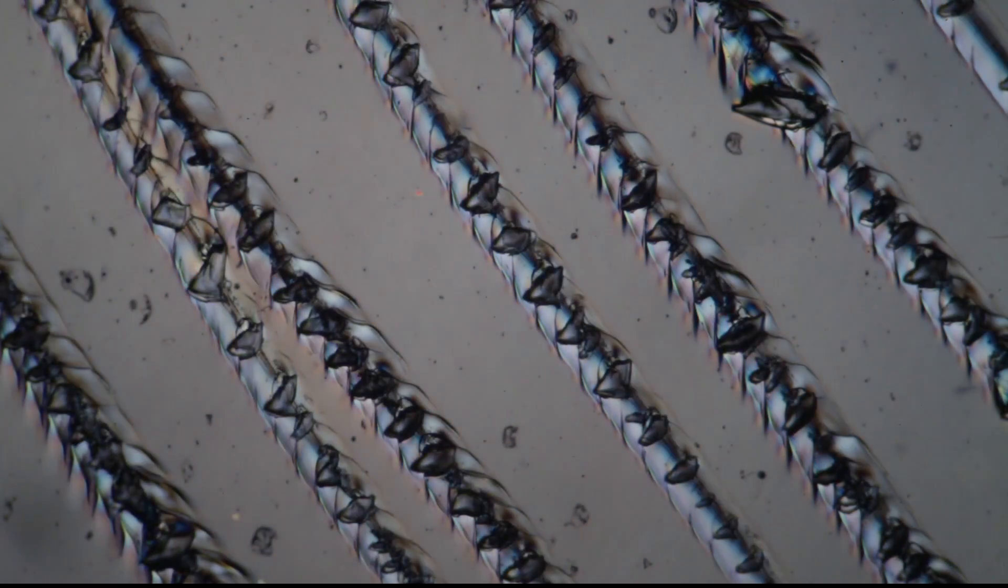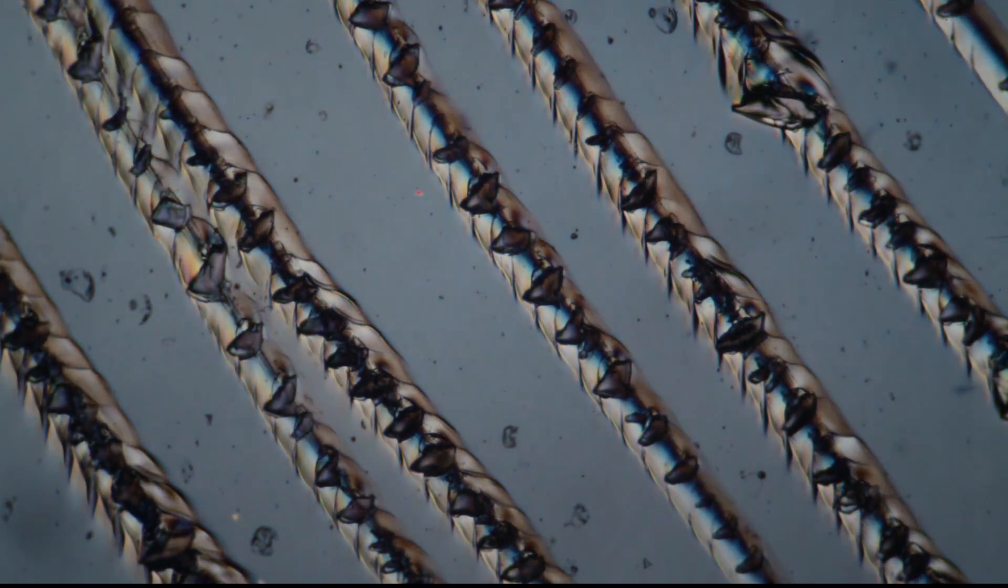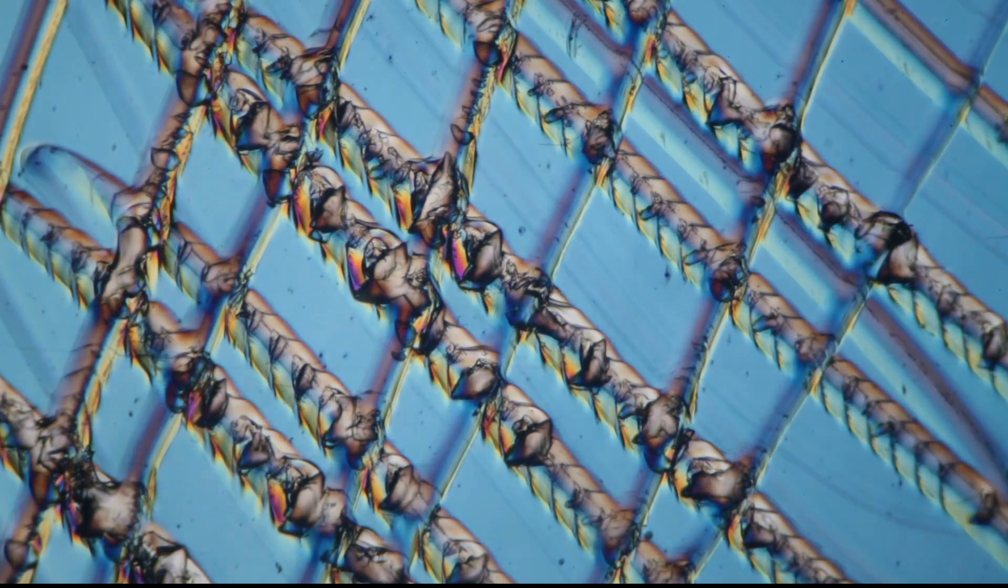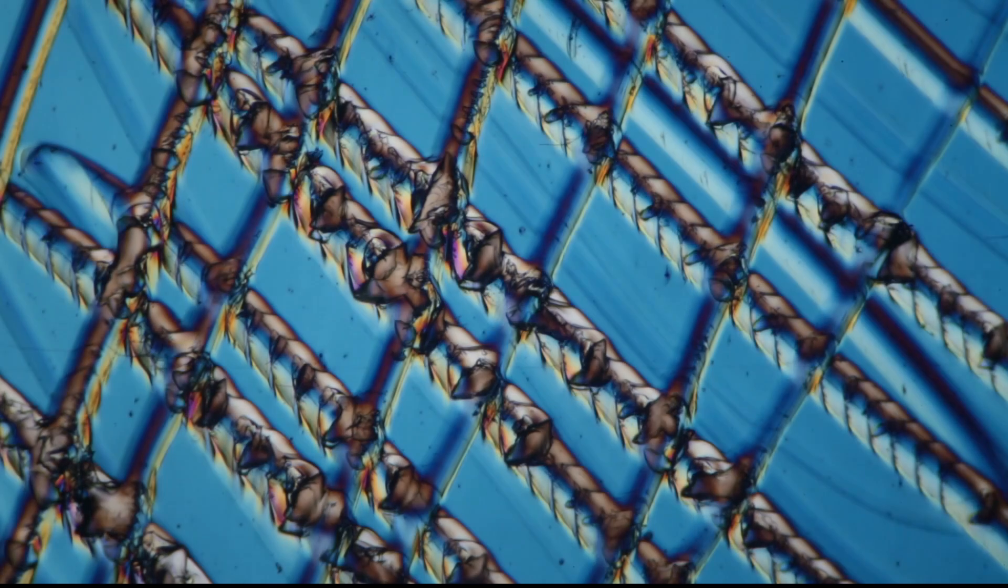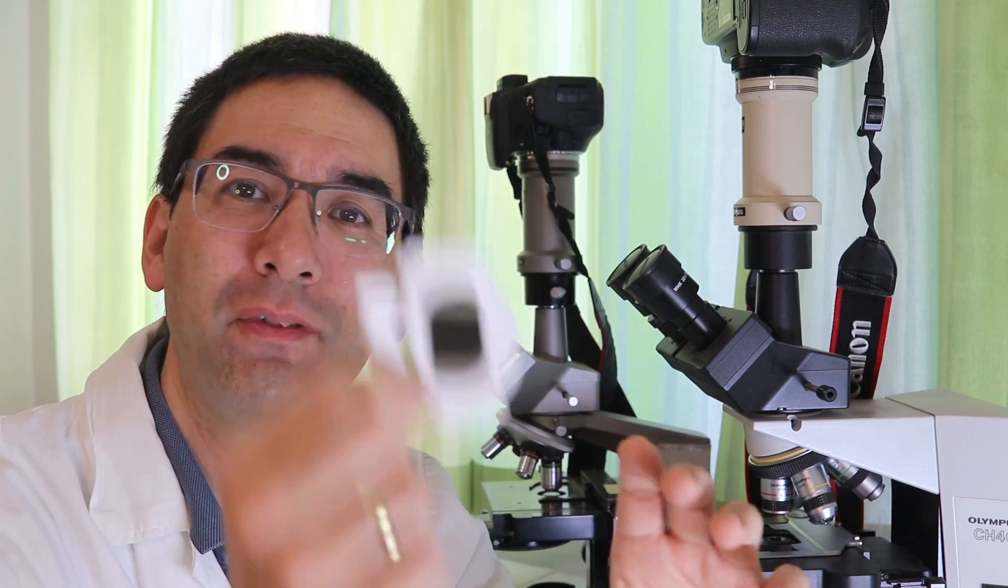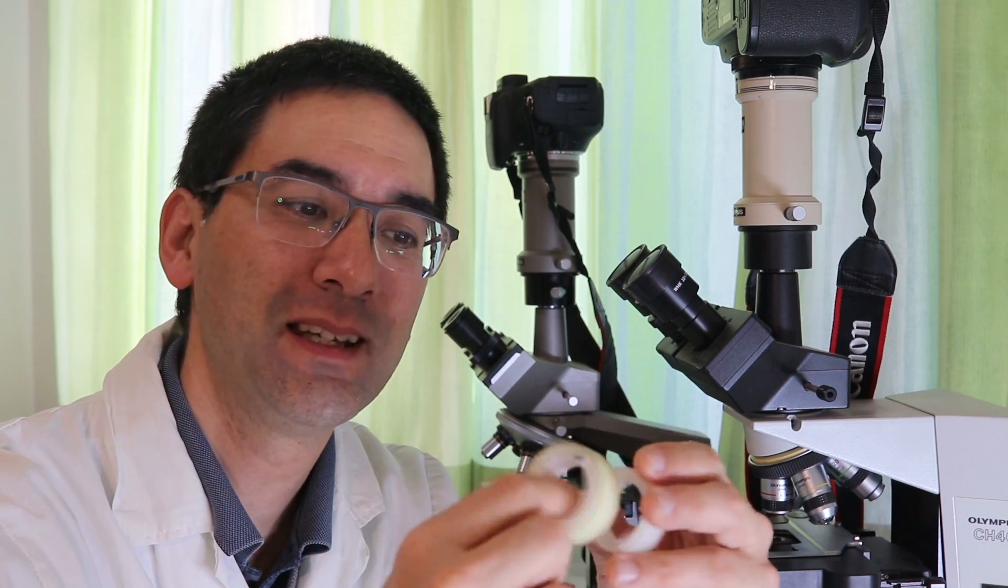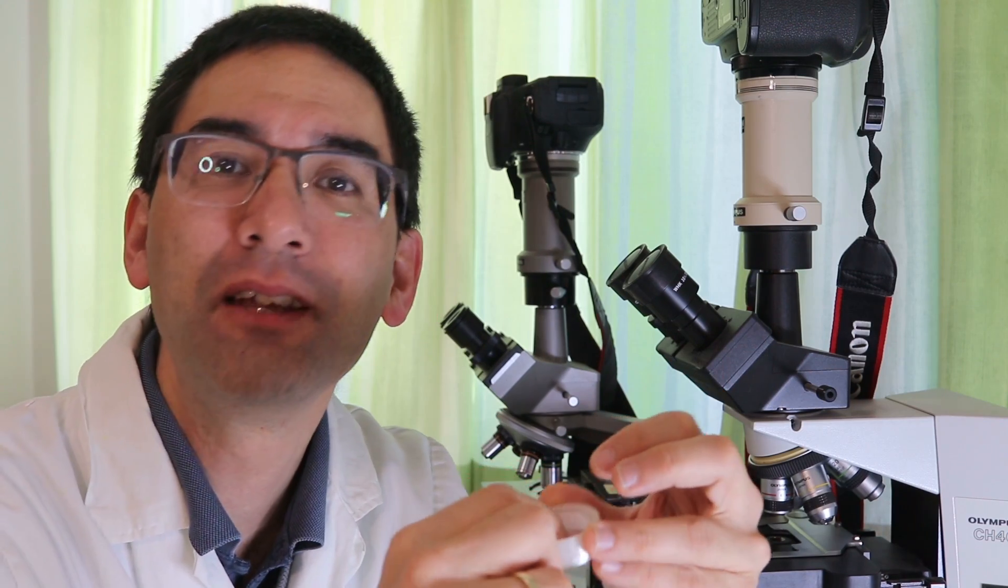And we're back at the sticky tape. It looks kind of artistic, even I would say. And always happily turning the filter. So you can see that it's quite easy to improvise filters this way, and simply by putting different types of plastic and also by applying some tension to the plastic you get some quite interesting effects.